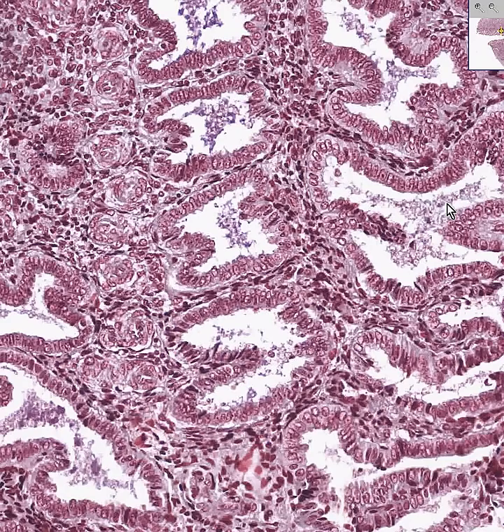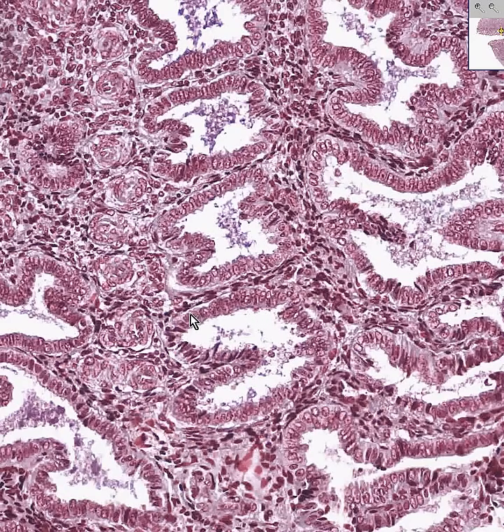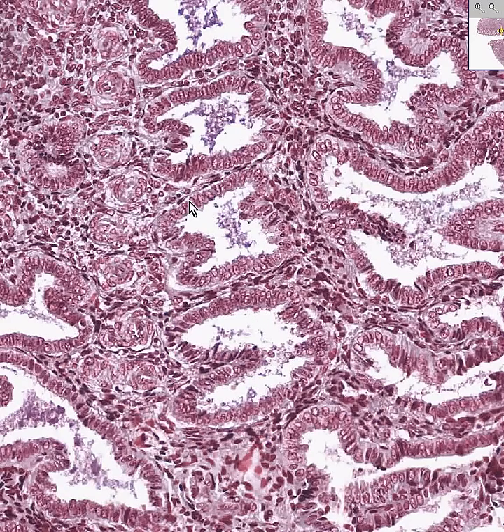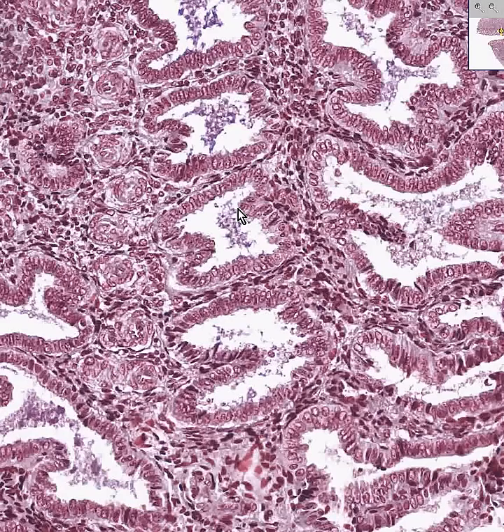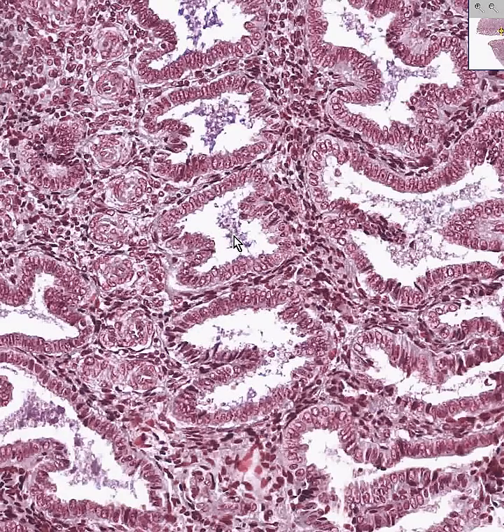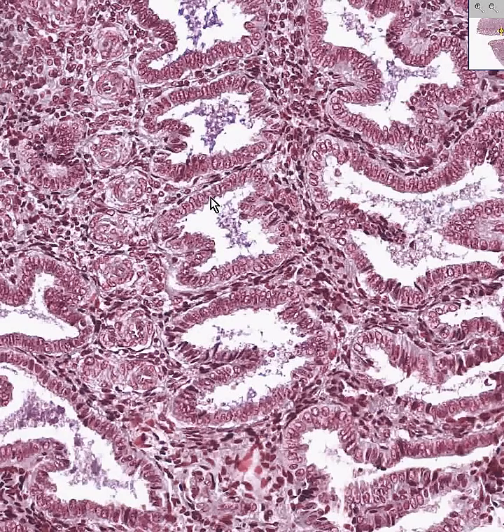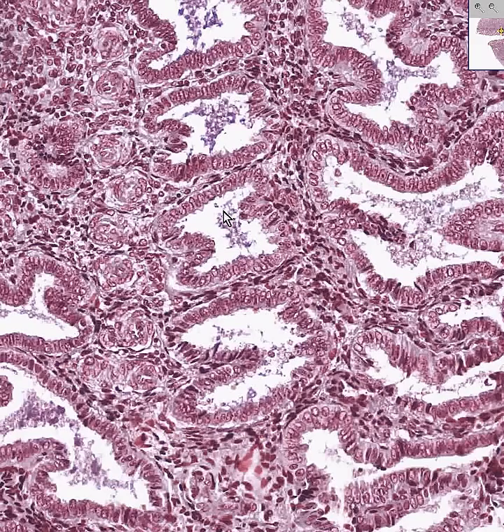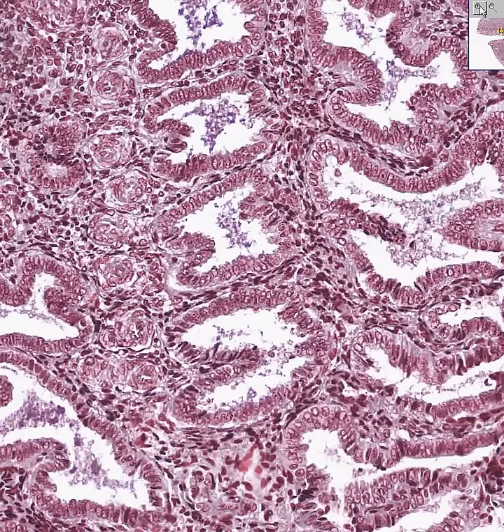In the early part of the secretory phase, you will see vacuoles in the cells. But in the later part, which this is, you can see that those vacuoles are gone because they have released all their secretions into the lumen.